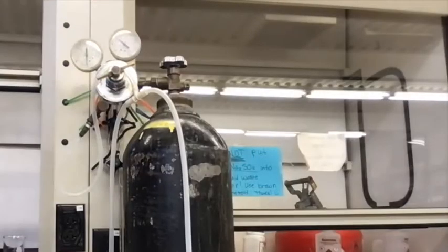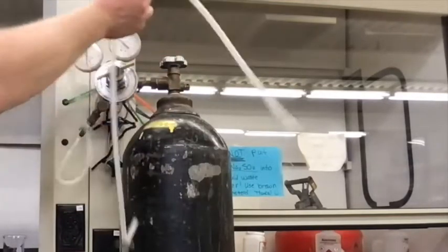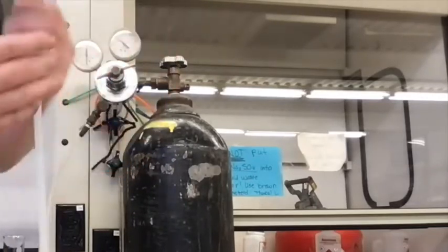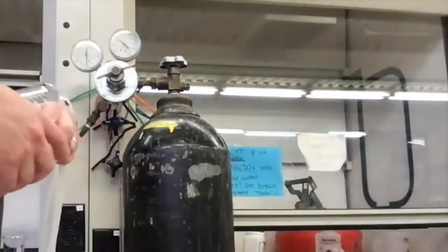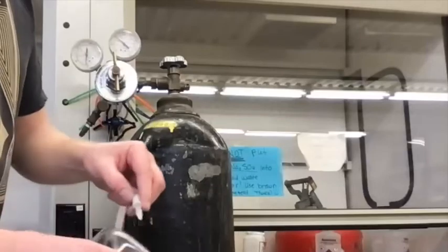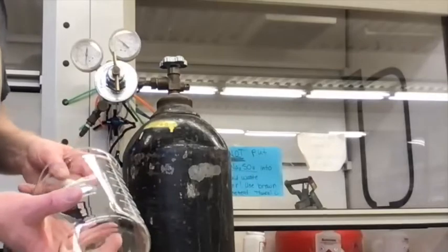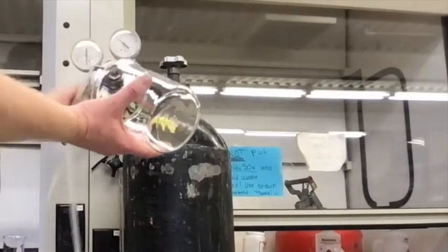So now I have inside of here about 8,000 kilopascals of pressure of nitrogen. And now I'm not letting anything out. When I screw this in, I'll eventually feel the nitrogen gas coming. And so I could use that as a rich man's way to dry your glassware really fast. You wouldn't normally do this. It's wasteful, but do this quickly. And actually, as far as wasting goes, we've wasted almost nothing in lab this year since we haven't had all of you in here doing stuff.